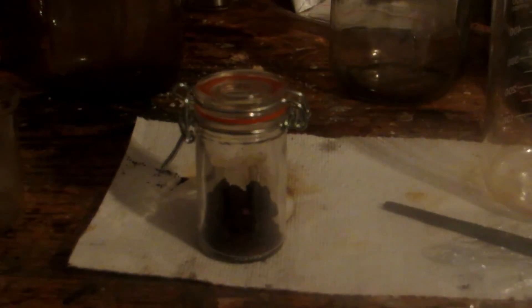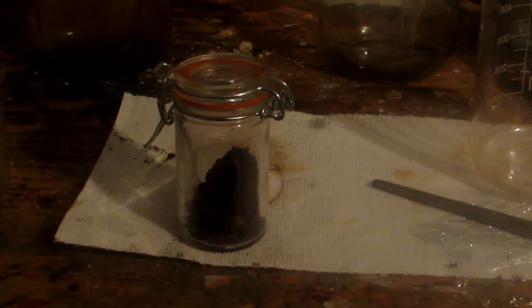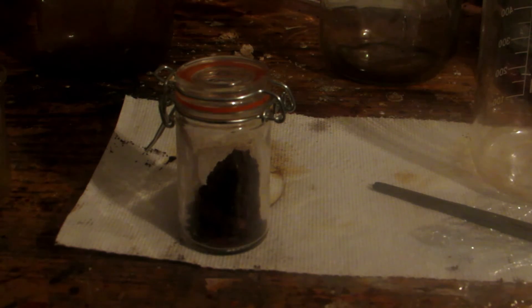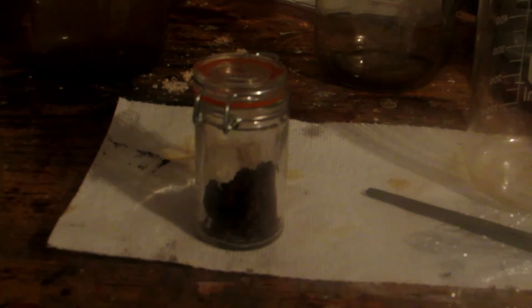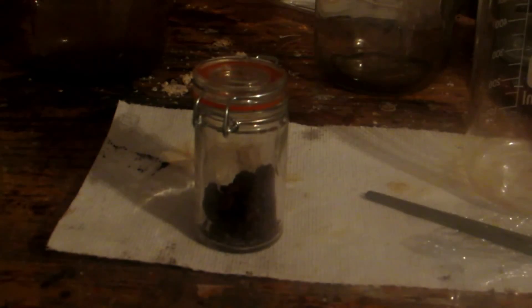After drying in the small beaker, we're left with some beautiful chunks of Iron 3 Chloride. The camera doesn't pick it up so well, but it is a slight purple color. Depending on how the light hits it, it appears to be different colors. According to Wikipedia, under transmitted light it's purple, and under other lighting conditions it appears different colors. Just remember when drying this, do not heat it above somewhere between 200 and 300 degrees Celsius, because it will decompose to Iron 2 Chloride and release chlorine gas. To be safe, don't heat it above 200 degrees Celsius.